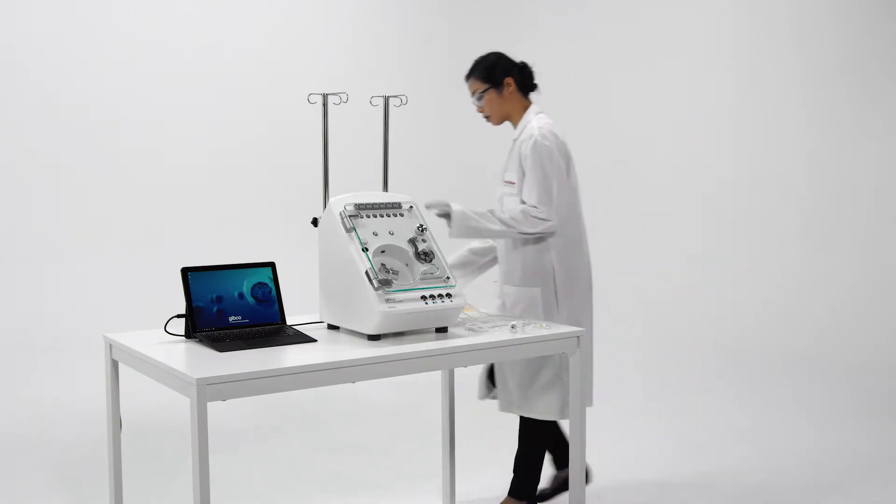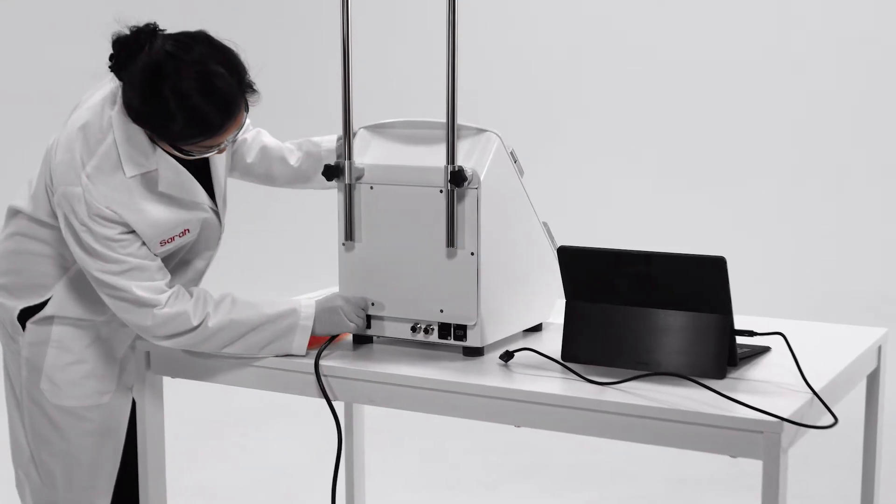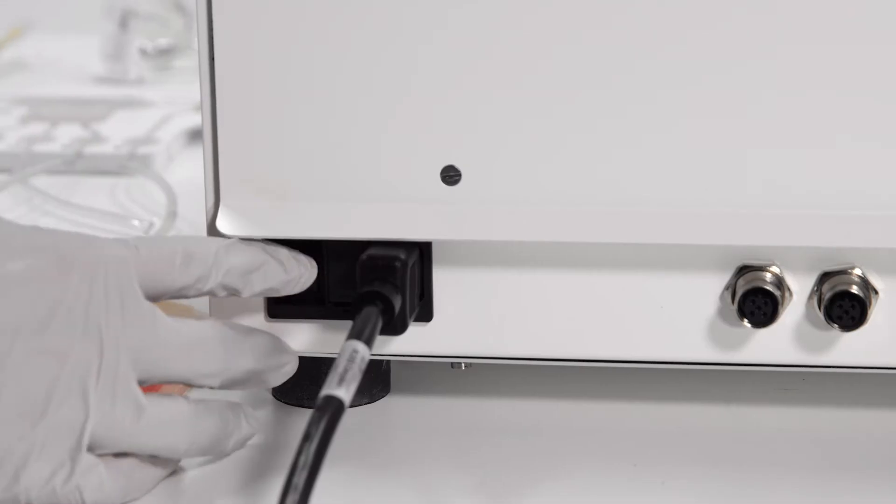First, set up the instrument, plug in the power cord, and turn on the instrument using the toggle switch on the back.